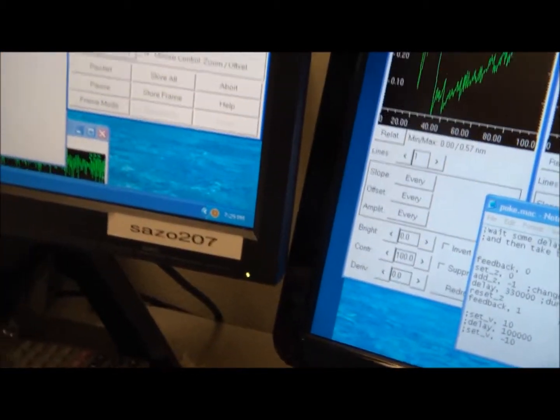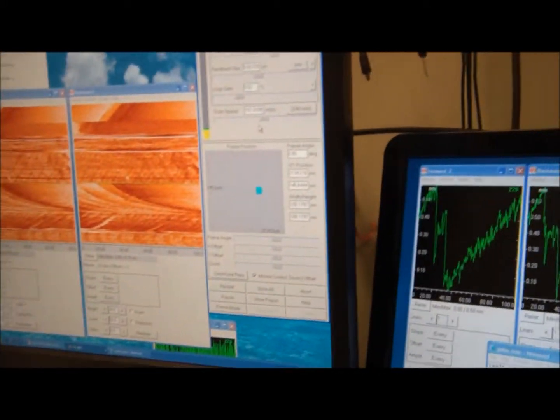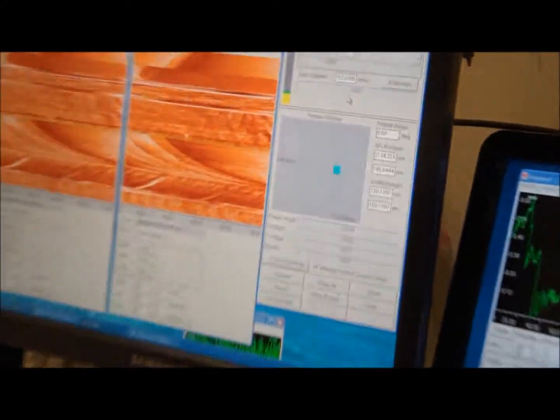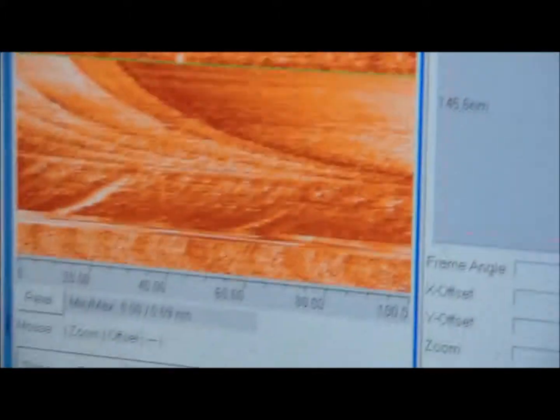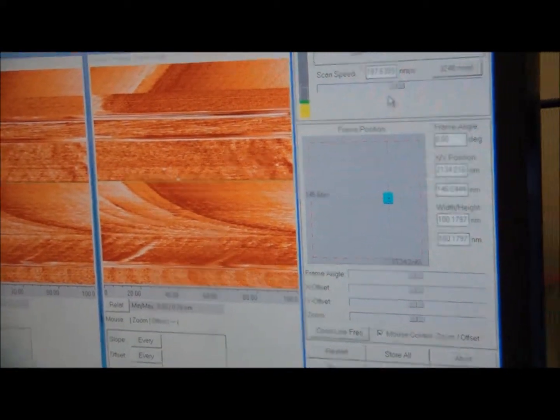So I see there's still noise here. Sometimes a technique that Brandon uses a lot is to just let it scan, let it go through its scanning. So as you can see right now, it's getting better and better. And if you let it go through the scanning process, then it will continue to get better. But then it will reach a peak. So basically, you want to continue to scan it, and then see if it gets better.